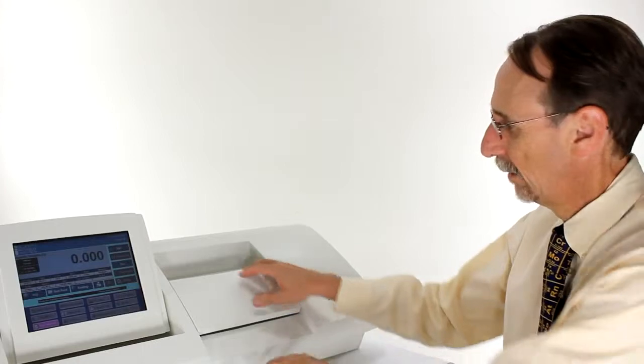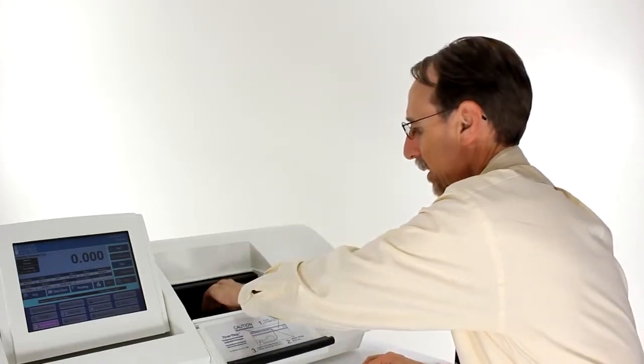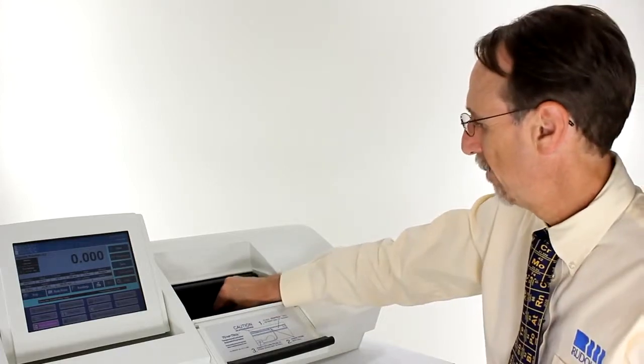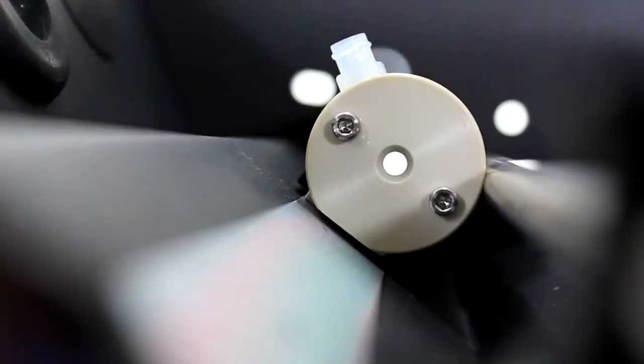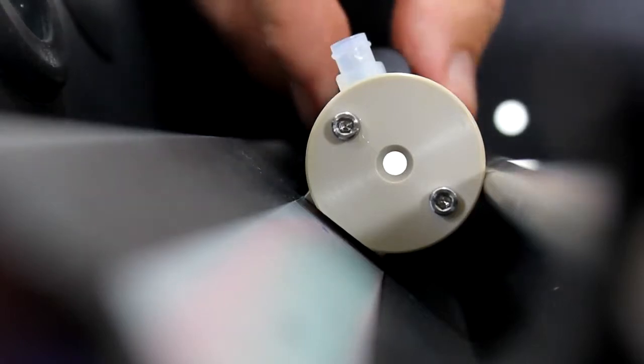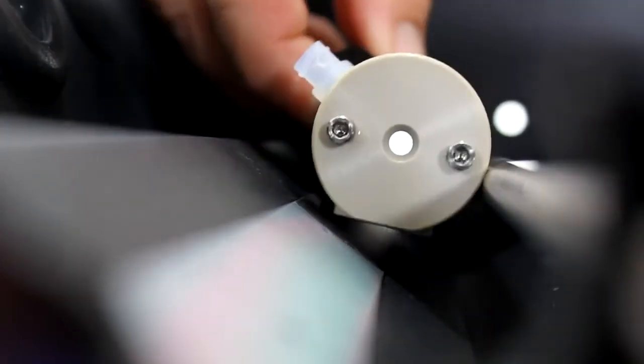Now that I've filled the cell I'll place it inside the instrument. I'll place it in the trough and move it to the right hand side. When placing the cell inside the trough, ensure that the back part of the cell mates correctly with the Temptrol section at the back of the trough. This is important because this is the section where the heat is transferred across. Ensure that the cell is not canted.